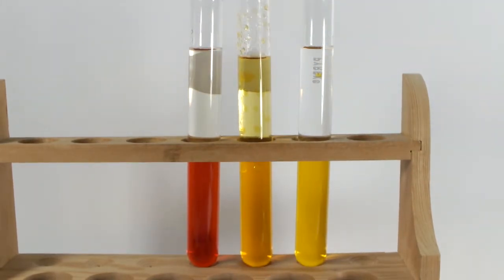So there is some yellow color that moved to the organic layer. The water droplets are stuck on the wall in the upper layer, and they're clearly more strongly colored.